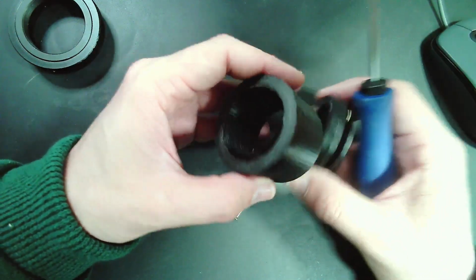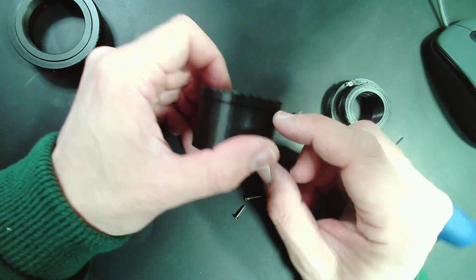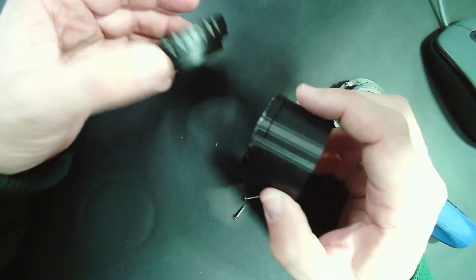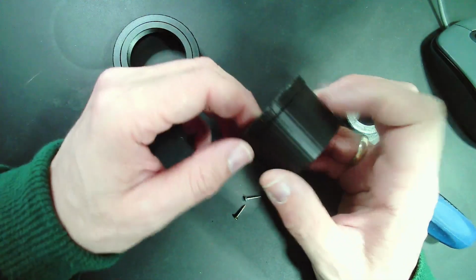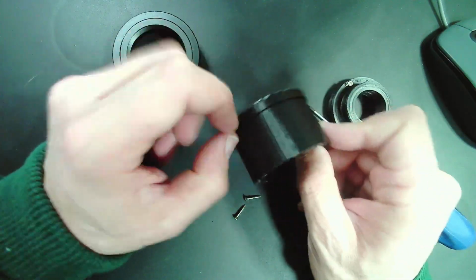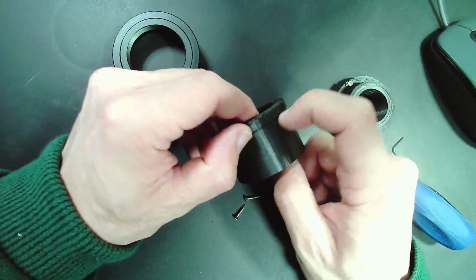Now the other side of the tube here, you see it's a little bit thicker than the rest, and I made it so that it fits better into the T2 adapter ring, but what I should have done is I probably should have printed everything a little bit thicker. Then it's not necessary to have this little rim here.